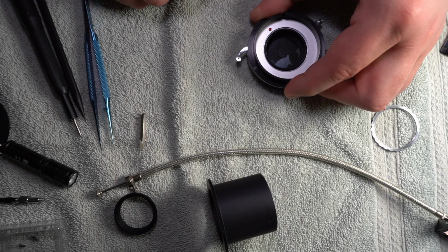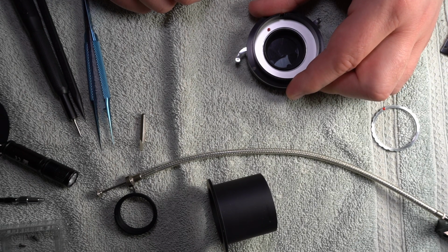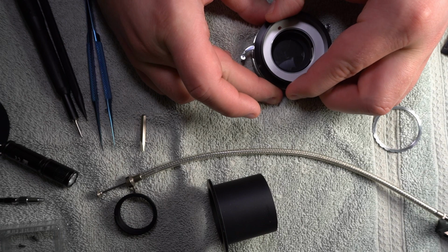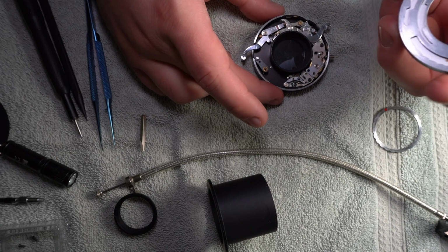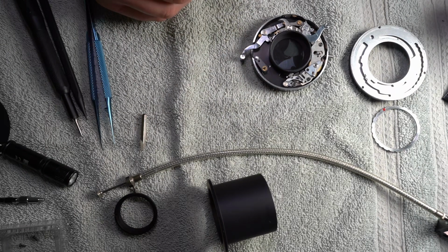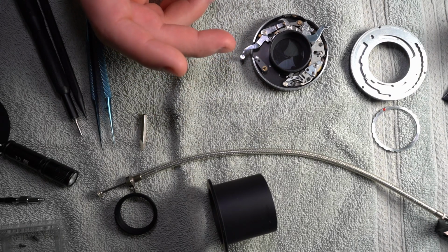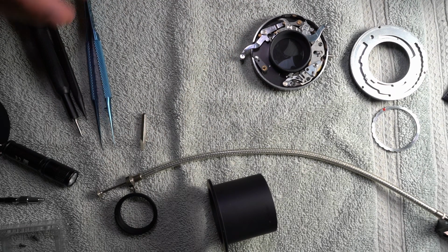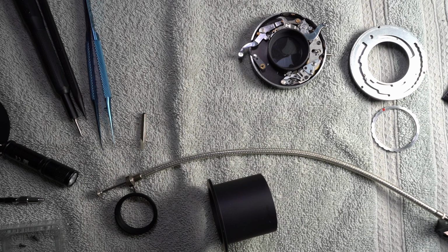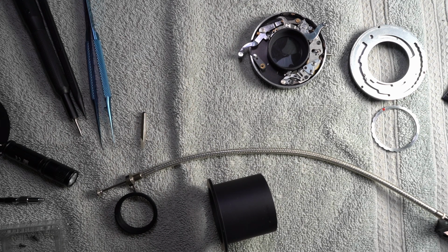There's some other pieces I should have oiled, but actually, you know what? Now that I do know how it goes, I have to do it. I have to do it. I just can't not. It'd be really stupid to take this all apart, get this all done, and then be like, oh yeah, I really should have done that because it was actually important after all, because it broke the next day.